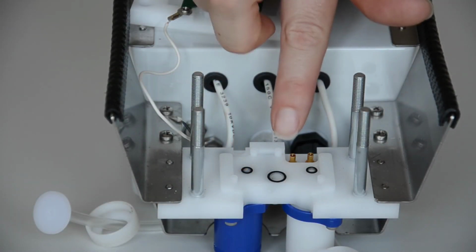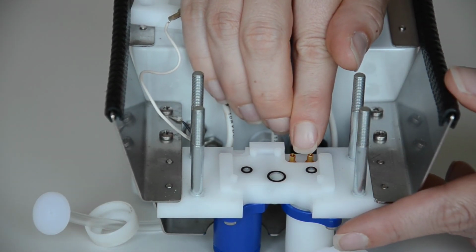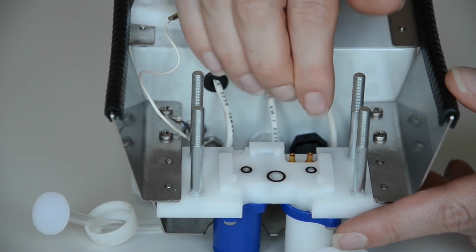It's very important that the electrodes that contact the chip can be moved. If they are stuck with buffer solution and they are no longer movable, then they will cause damage to the chip.